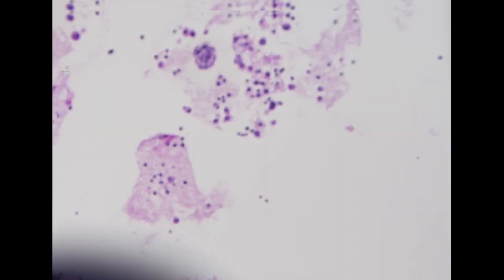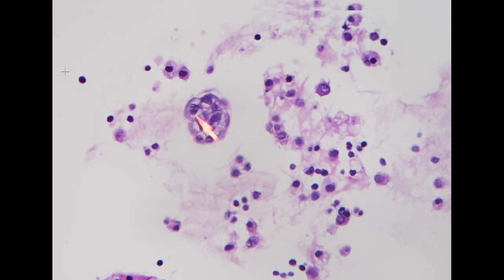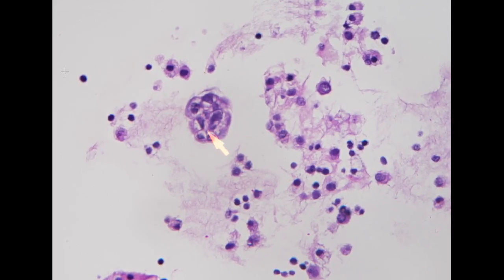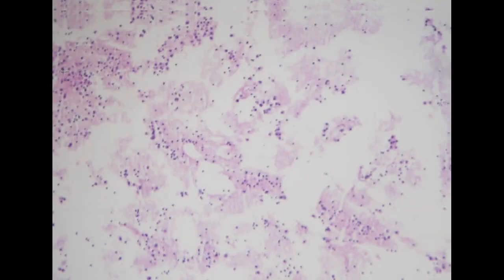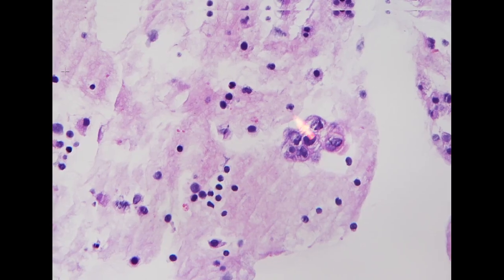And this is the cell block preparation. In the cell block, we do see a similar cluster in the loose end. Vacuolated cytoplasm in a tight cluster, and the morphology is consistent with pancreatobiliary origin cancer. So for this specimen, we are still calling these positive for adenocarcinoma. You see this tight tubular structure, and this one as well. So this is positive, and the morphology is consistent with pancreatobiliary origin.